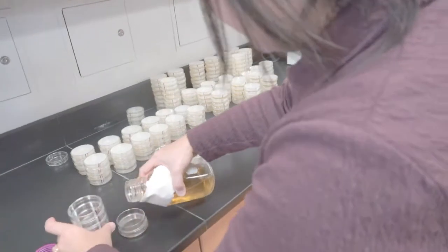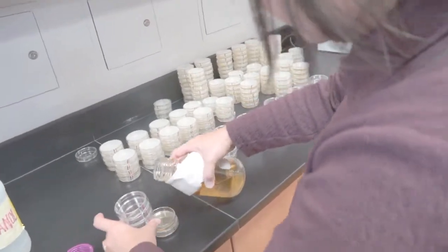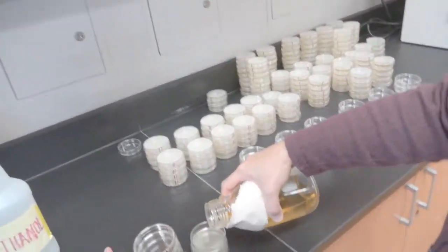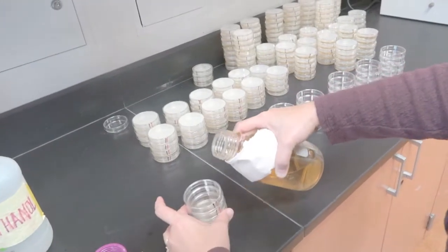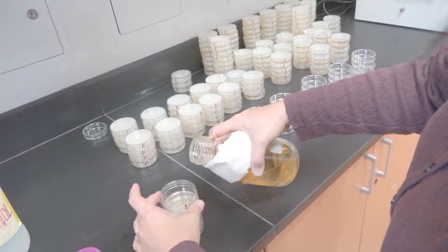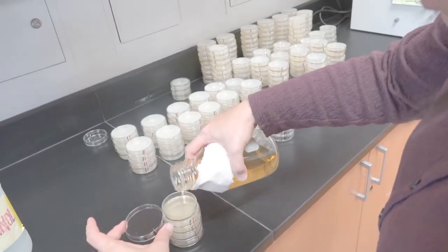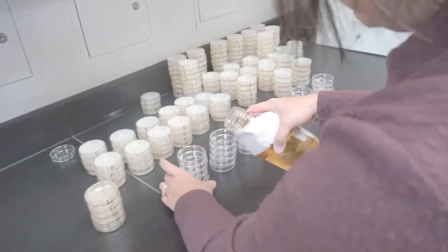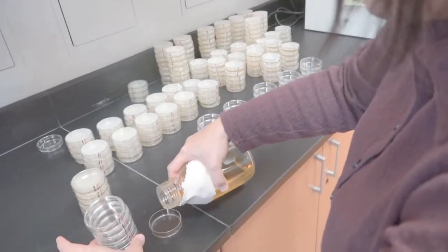You want to pour so it covers the bottom of the plate. Initially, if you're a beginner, you might pour too thick, which is fine. We give you enough for more than a sleeve. Once the stack of five is done, I'll move it aside and move in the next stack.